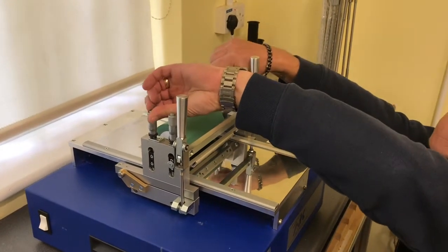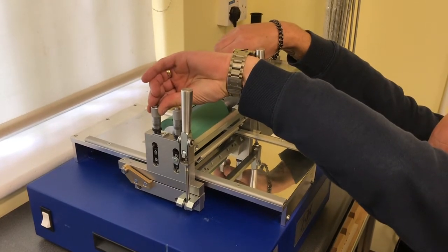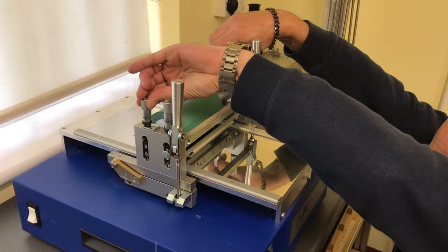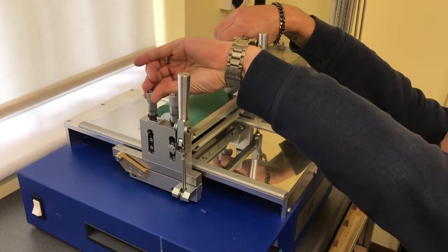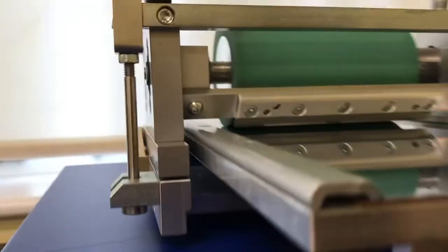Bring the roller down until it just touches with no pressure. There's no gaps at all, there's no excess pressure.